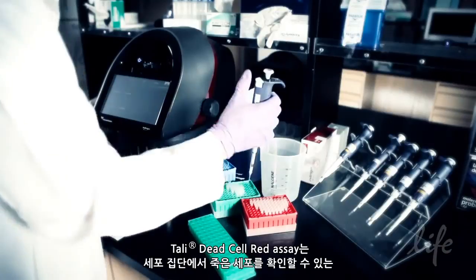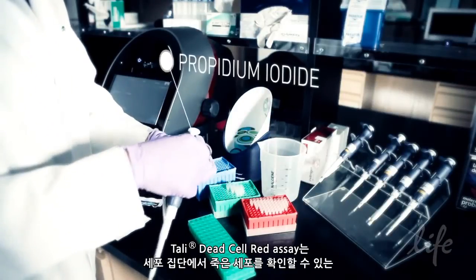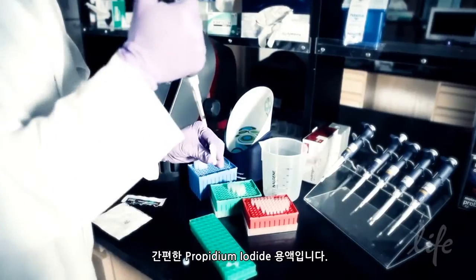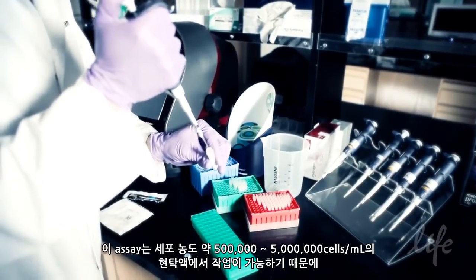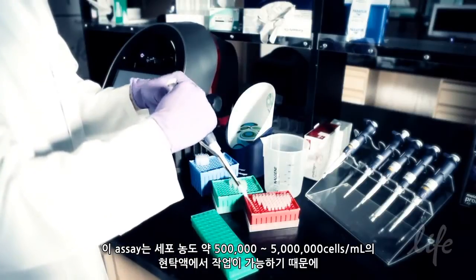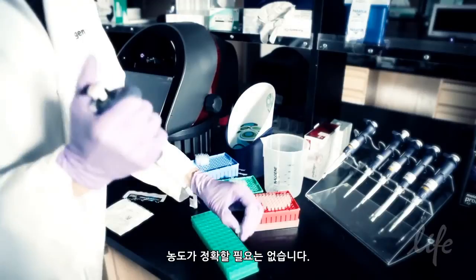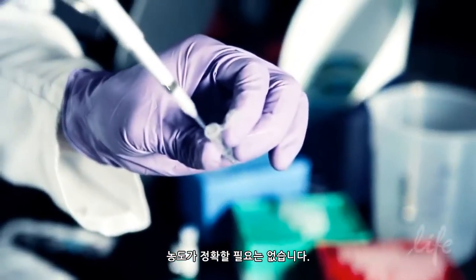The Tali Dead Cell Red assay is a ready-to-use solution of propidium iodide that is used to identify dead cells in a population. This assay works well on cell suspensions containing about 500,000 to about 5 million cells per milliliter, so the concentration doesn't need to be exact.